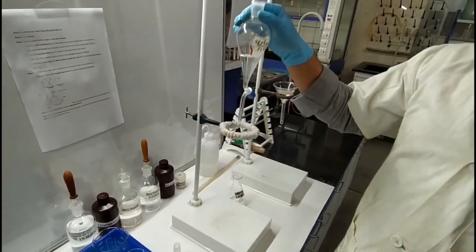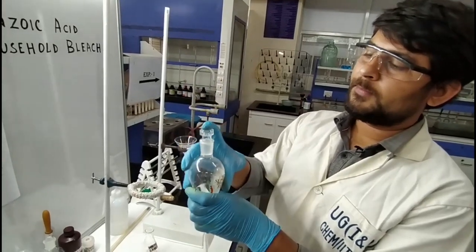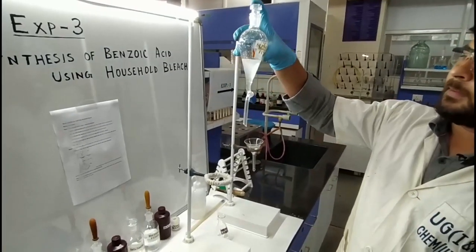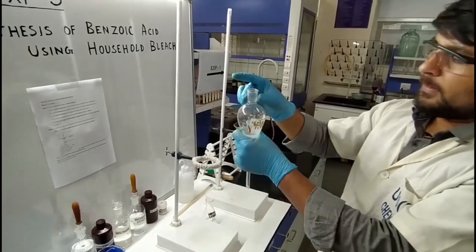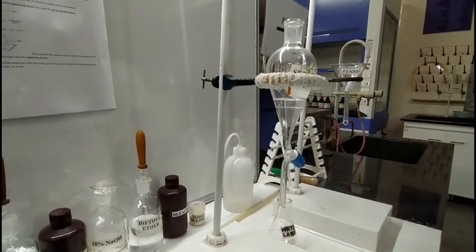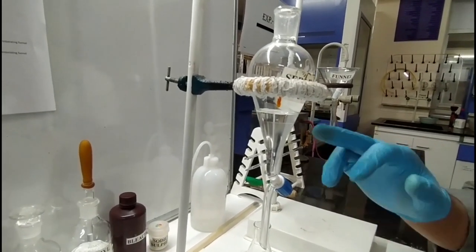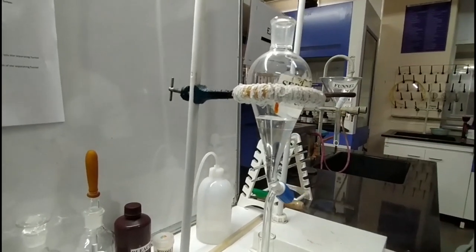Now we have to remove this from the ring and put the cap on top, then shake the two layers properly like this. Now we have to open the stopcock slowly and keep it inside the ring again so that the two layers separate properly. Now you can see two layers are separated — the upper layer is diethyl ether and the lower one is water, so the lower one is the aqueous layer and the upper one is the ether layer.